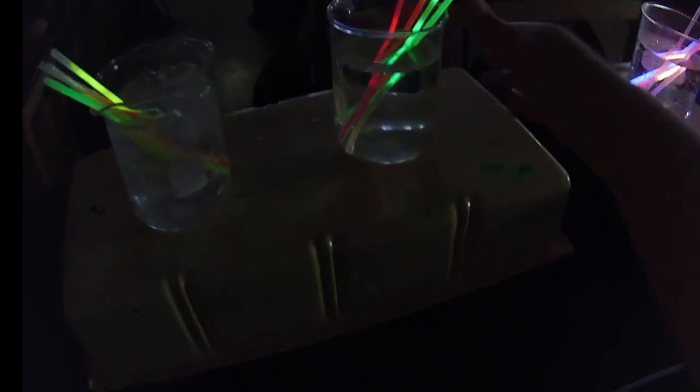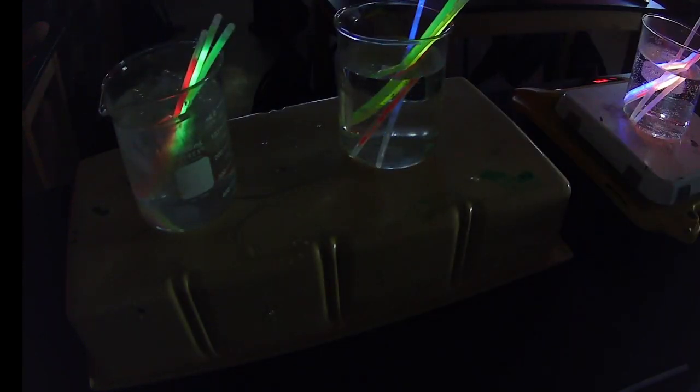Let's try this. Let's take some of these. I'm going to switch this way. The ones that are just working, okay? And you can play with these and put them back and forth. Because remember, when you're looking at this reaction, the heat and light is a product, right? So I can force it to make a lot of product or a little bit of product, okay?